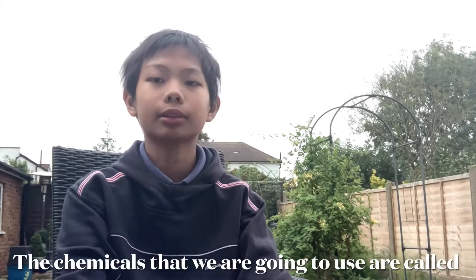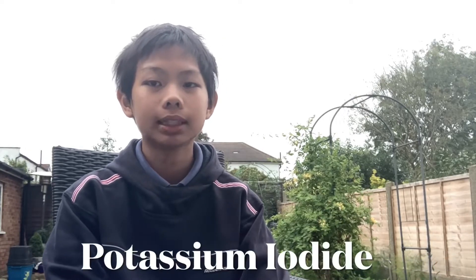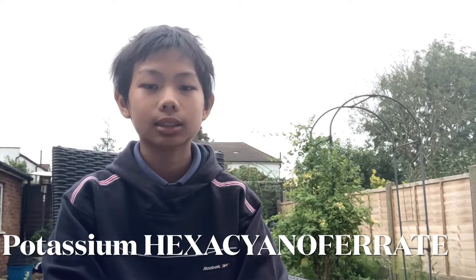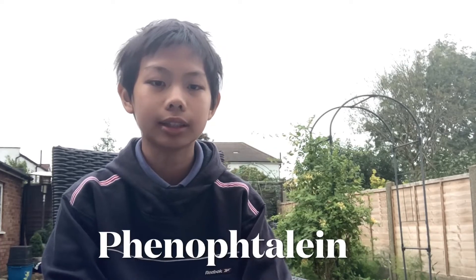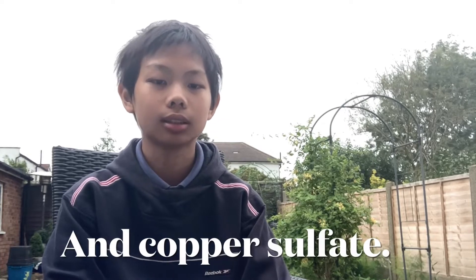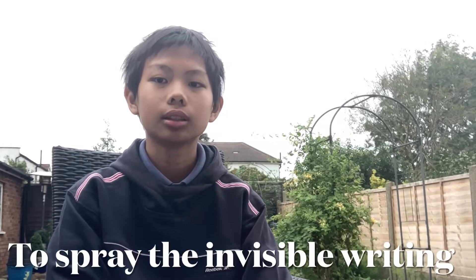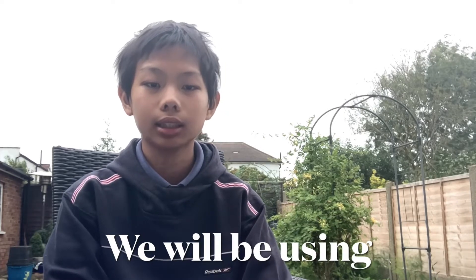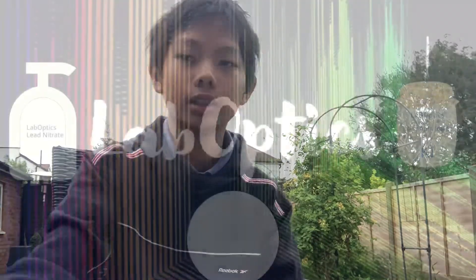The chemicals that we are going to use are called potassium iodide, potassium hexacyanoferrate, phenolphthalein, and copper sulfate. In spray bottles to spray the invisible writing we will be using lead nitrate, iron nitrate, and ammonia.